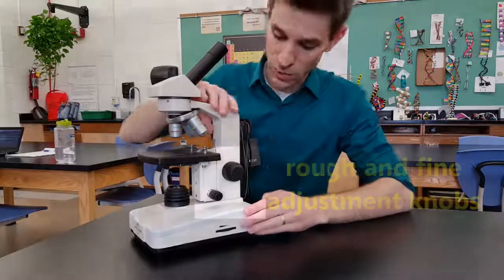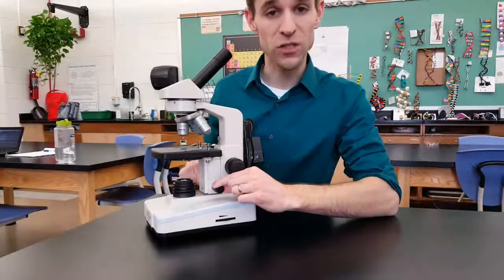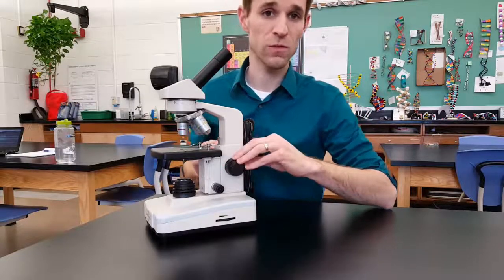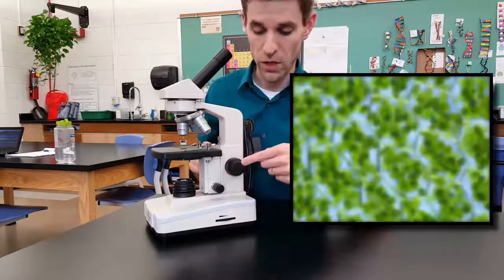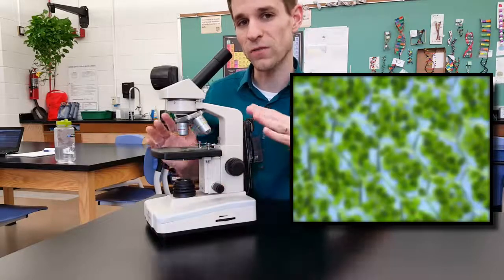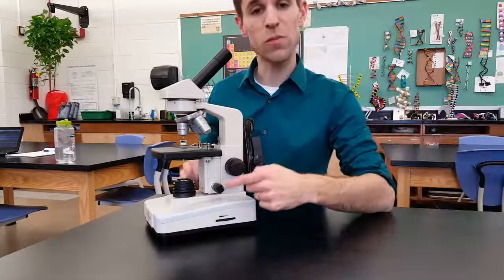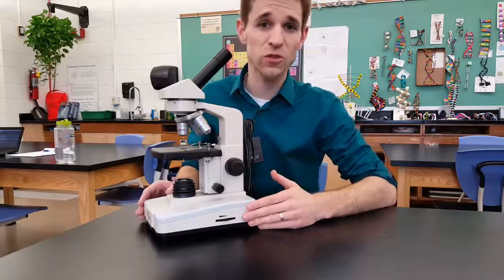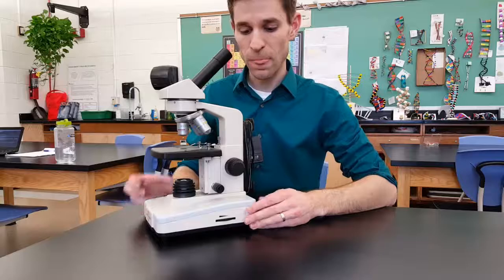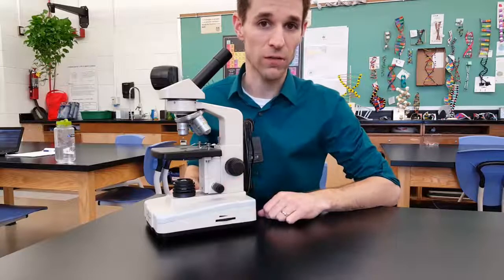We have the adjustment knobs — a large one and a small one. The large one moves the stage up and down a lot, whereas the fine adjustment moves the stage up and down just a little bit. So you can do rough adjustments — bring your specimen into approximate focus with the large coarse focus knob, and then once you have it approximately in focus, use the small knob to bring it into fine focus so you can see it a lot better. You want to use both knobs when focusing your specimen and see it in as fine detail as possible.